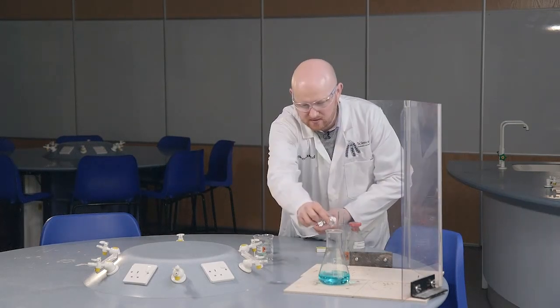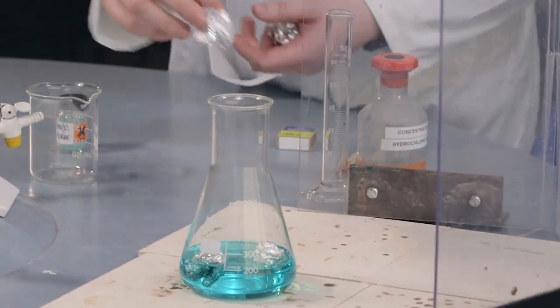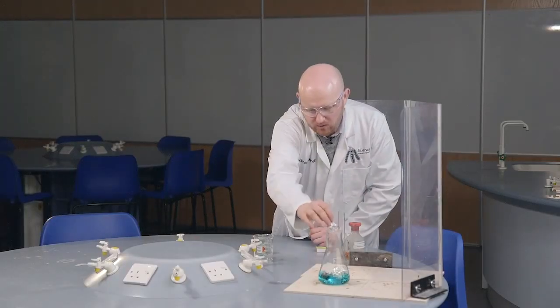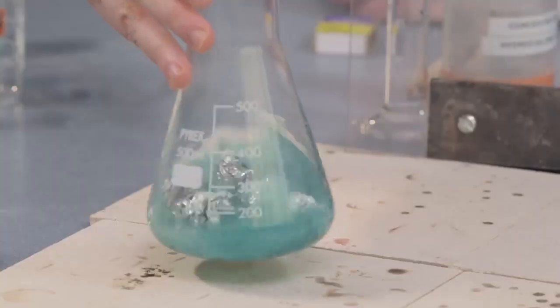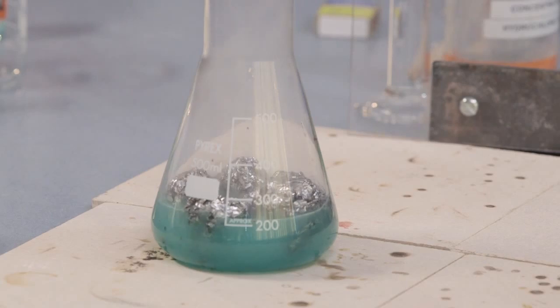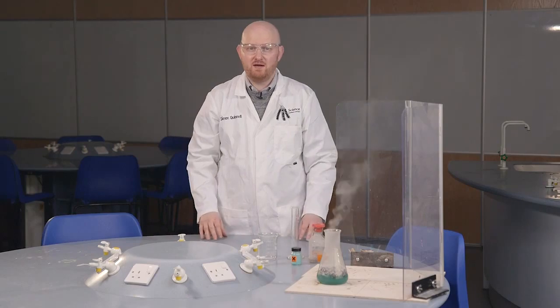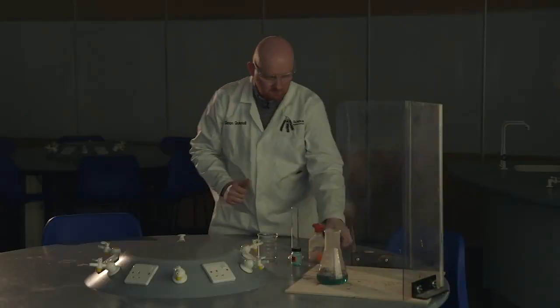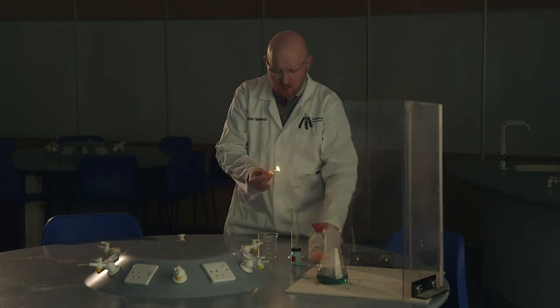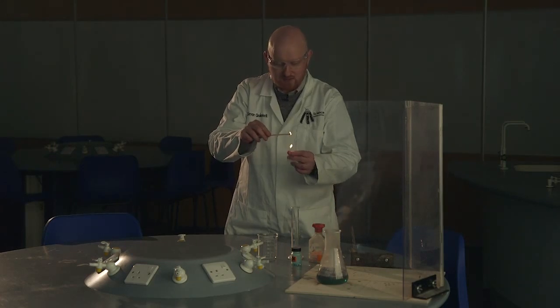So, I'm going to add the aluminium foil into our solution, and you should start to see it react quite quickly. Just give it a stir. You can probably already see it going quite dark. And can you start to see the hydrogen coming off as well? Now, the best way to see this is if we turn the lights off. Now, what we need to do is ignite the hydrogen that's coming off, and we should see our northern lights, which will light Santa's way to our house to deliver our presents.